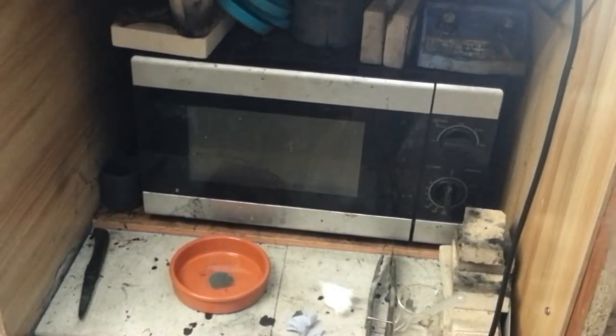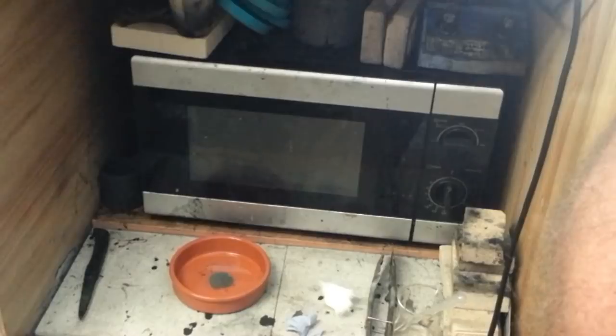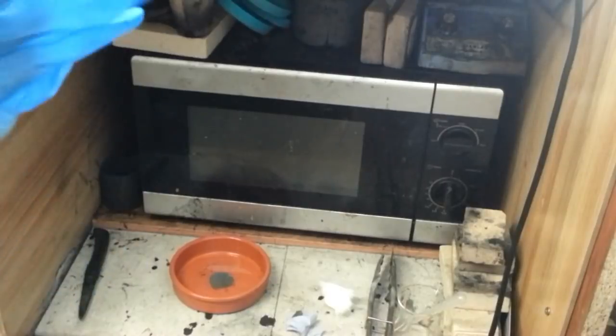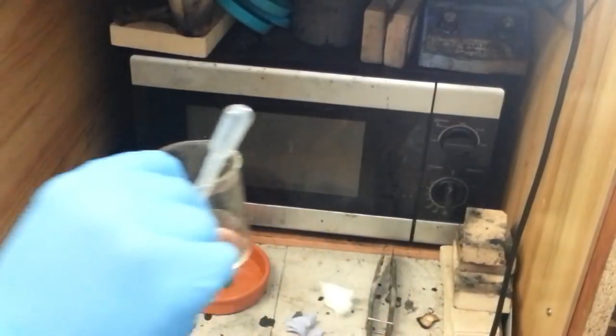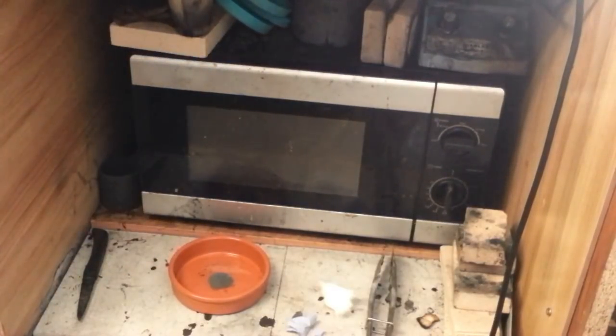Nothing like preparation — I've already got some eyewear on, so that's one thing. The other thing I'm going to do is put some gloves on, because I'm messing with sulphuric acid. There we go. And there we've got some concentrated sulphuric acid, and there we've got a couple of bits of organic material.